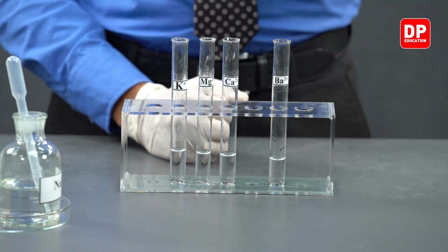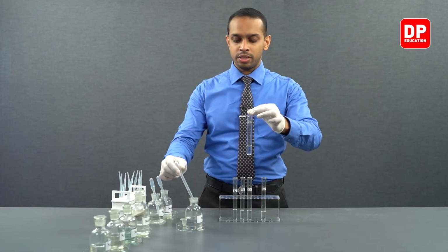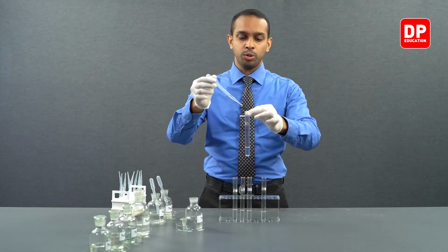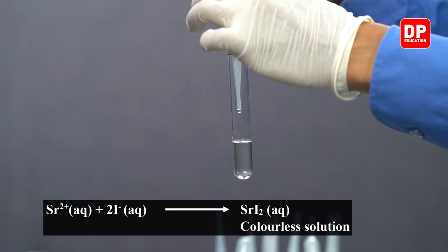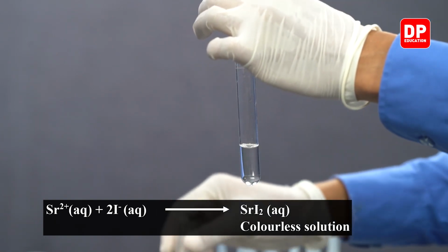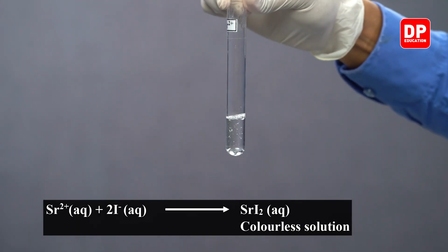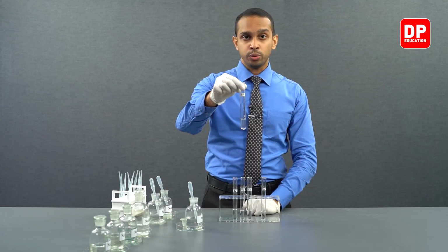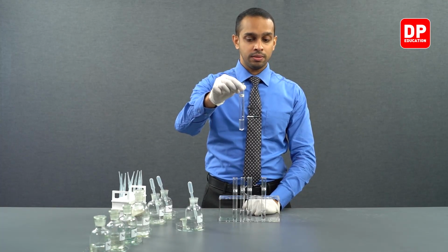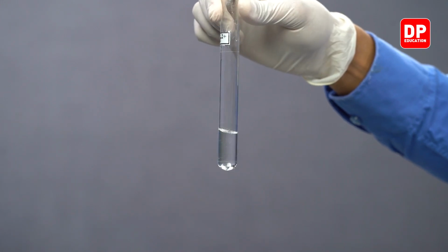Then we have our strontium aqueous ion solutions, strontium 2 plus. Let's add I minus ions, iodide ions. When strontium 2 plus ions come into contact with iodide ions, they also do not form a precipitate, as strontium iodide is soluble in water.